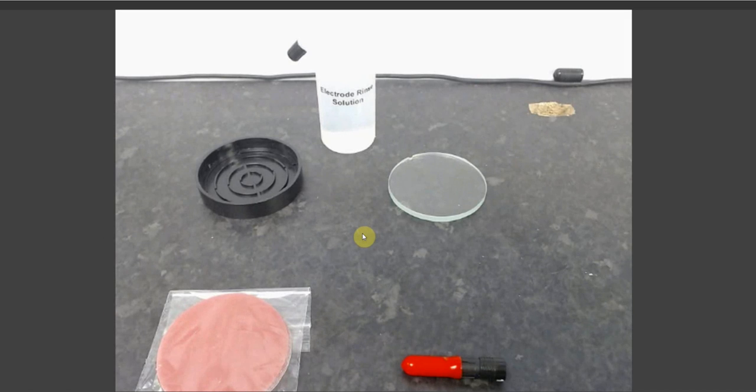Plating is one of the more important steps required for setting up your Metalyser. A degraded plate, or a plate that is uneven, or in the case of gold plate, co-deposited with mercury, will cause severe problems with your accuracy, repeatability, and reliability of your measurements.